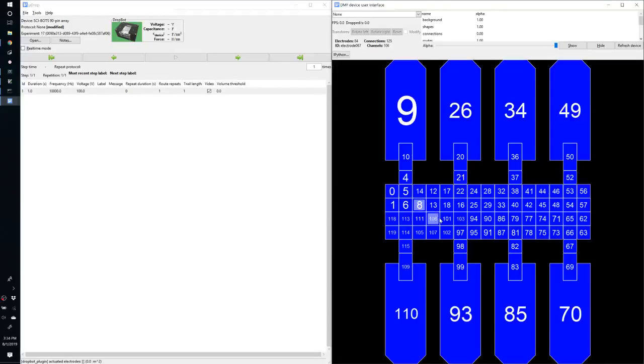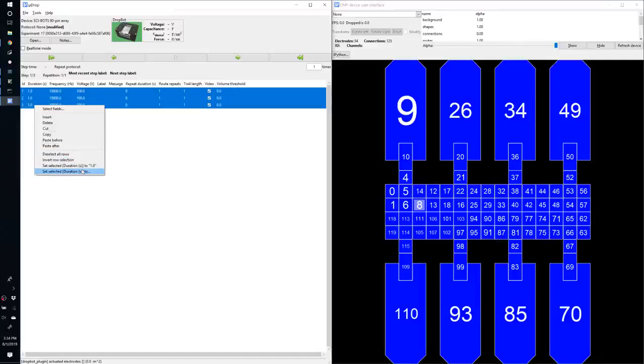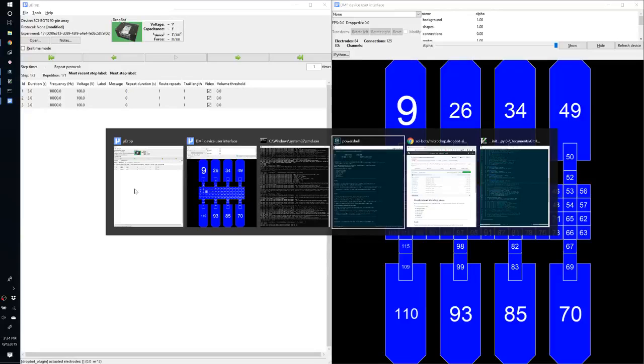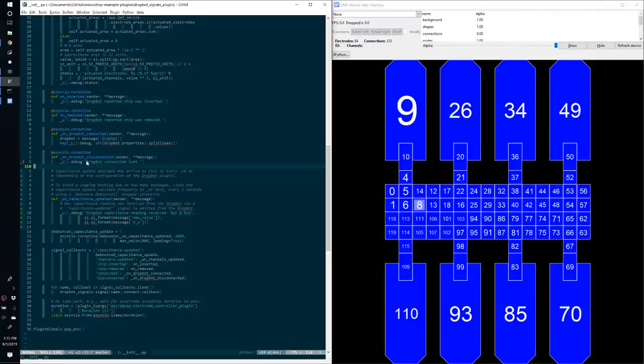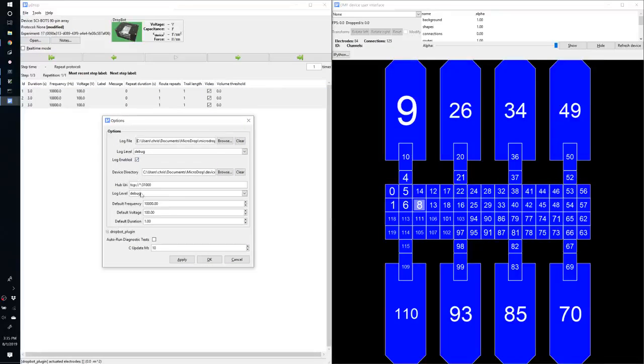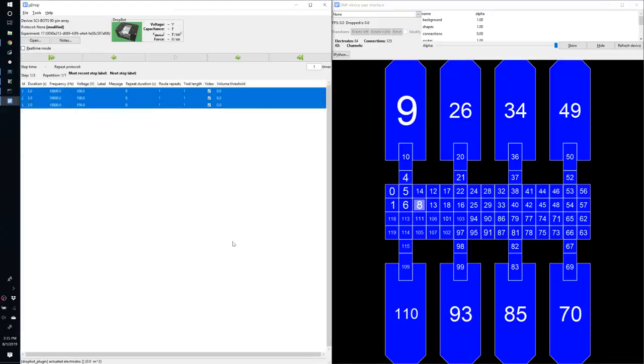and we'll turn on some electrodes. Actually, let's turn on 1, then 2, then 3, and we should be able to see the value going up on subsequent steps. So we'll set the duration to, say, 3 seconds so we get at least one update. Now, if we look, all of the messages are being logged to the debug level, so we want to make sure that under options, your log level and the file log level are both set to debug. In this case, they already were.